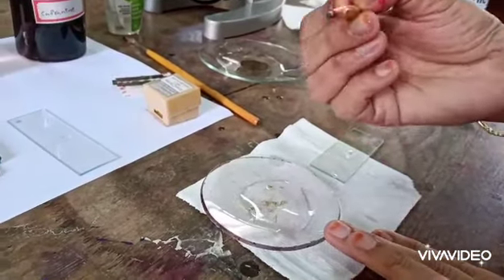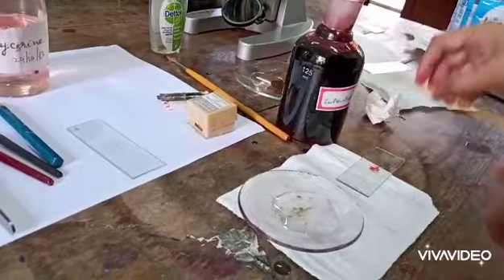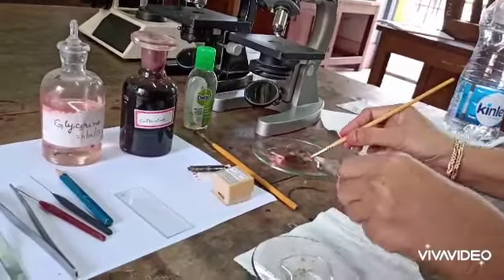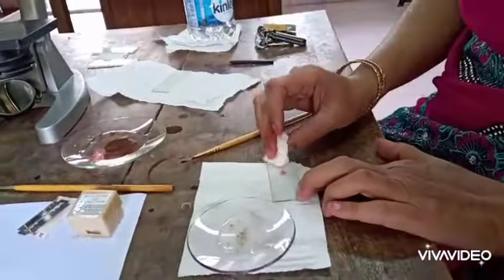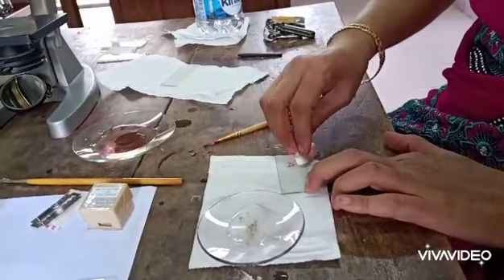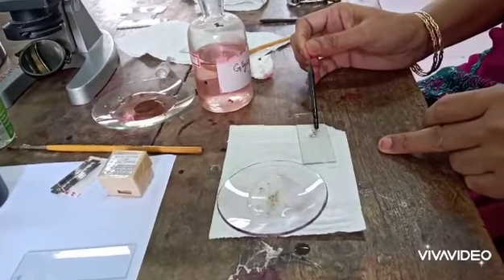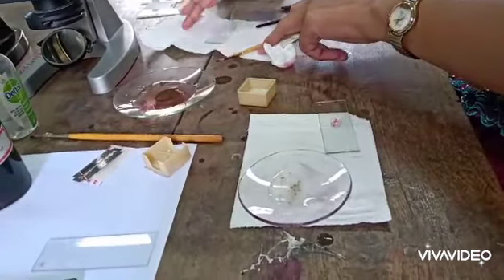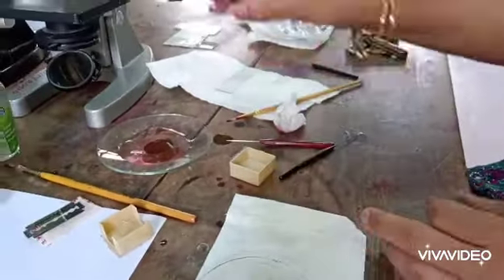With the help of a brush, select two sections, then take the stain. Put a little stain on the sections and mix it properly. The excess stain is washed off with water with the help of a brush. The excess stain and water can be removed with the help of tissue or blotting paper. Now put one or two drops of glycerin on the sections, then place the cover slip on the sections without any air bubbles, using needles.